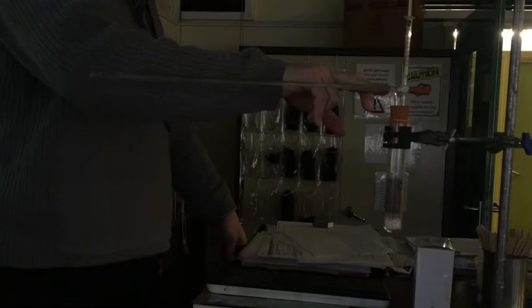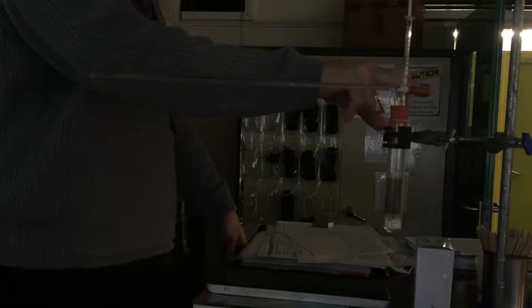Now at the moment the actual apparatus isn't sealed because we've got a three-way tap here. At the moment, the tap is pointed so that this bit is open to the air, because we want the tap to be open so that the maggots can still get oxygen from outside. We haven't sealed it yet, so this isn't moving.